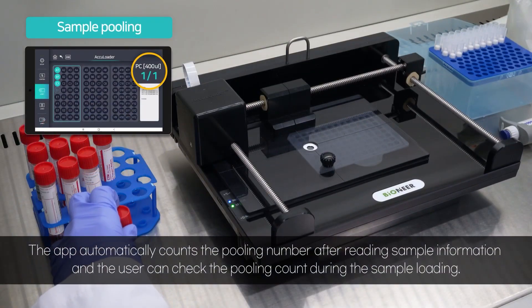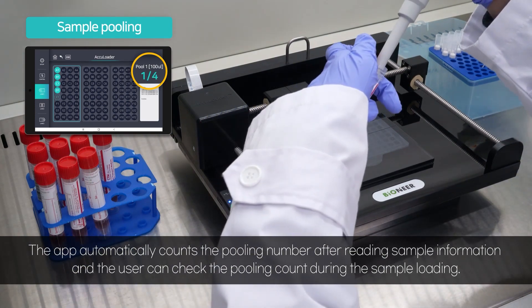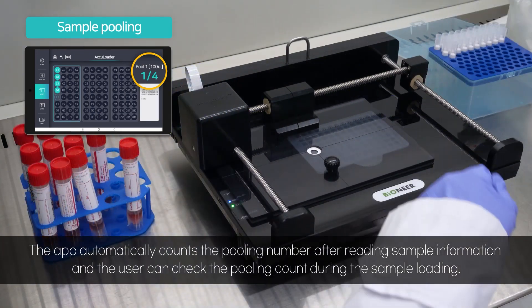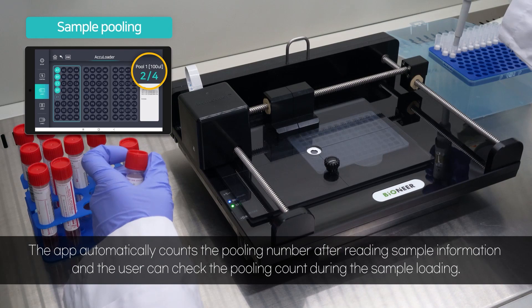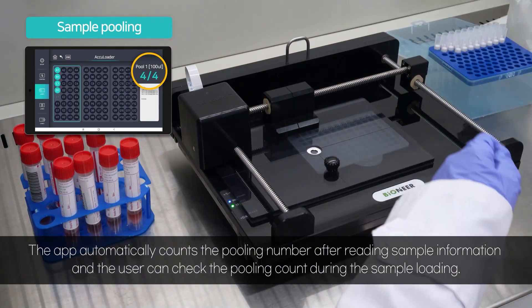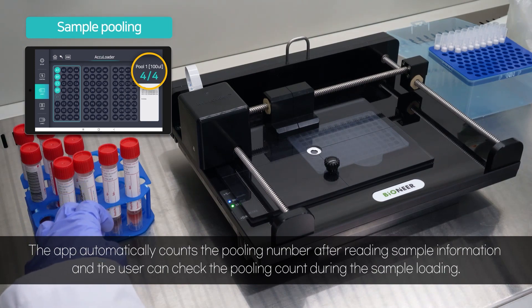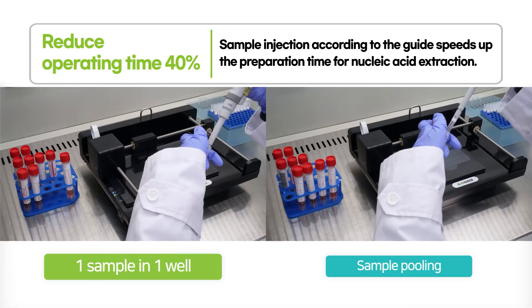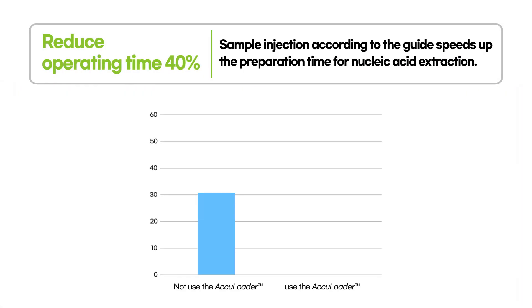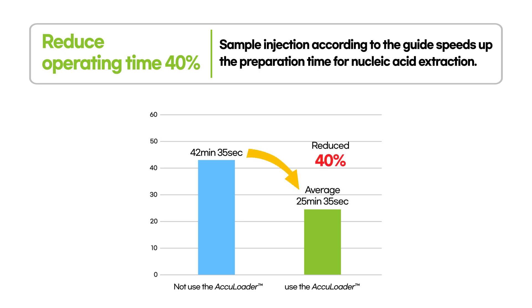For sample pooling, the app can automatically count the pooling number by reading sample information, and the user can check the pooling counts during sample loading. In the sample loading step, operating time is reduced by 40% with the guidance of AccuLoader.